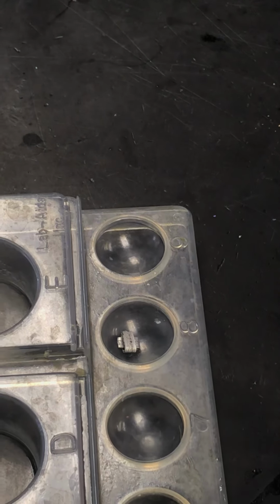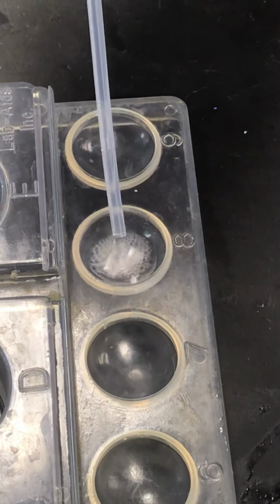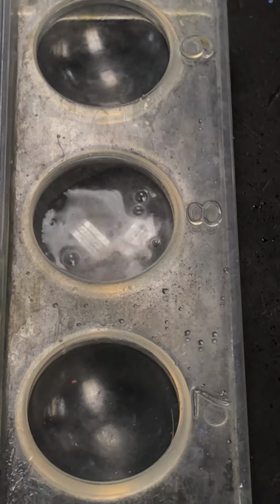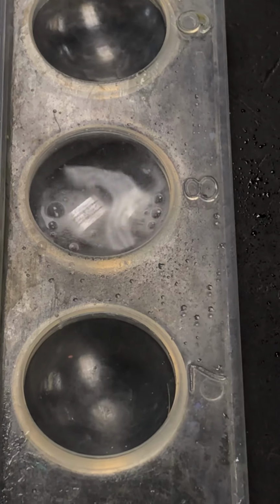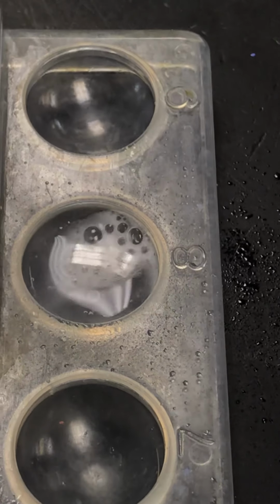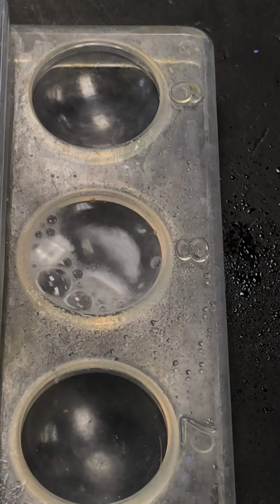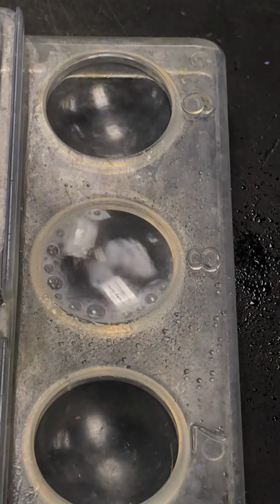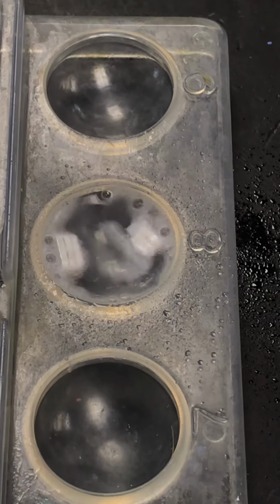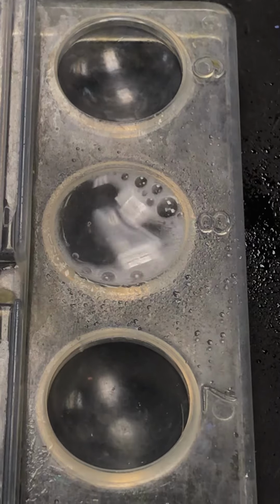Come on, a little tiny bit of hydrochloric acid. It's really bubbling. It's giving off some sort of a gas. Isn't that cool? It's disappearing. Now it's in two pieces, but it's getting littler. I guess we'll come back. But that was pretty cool.